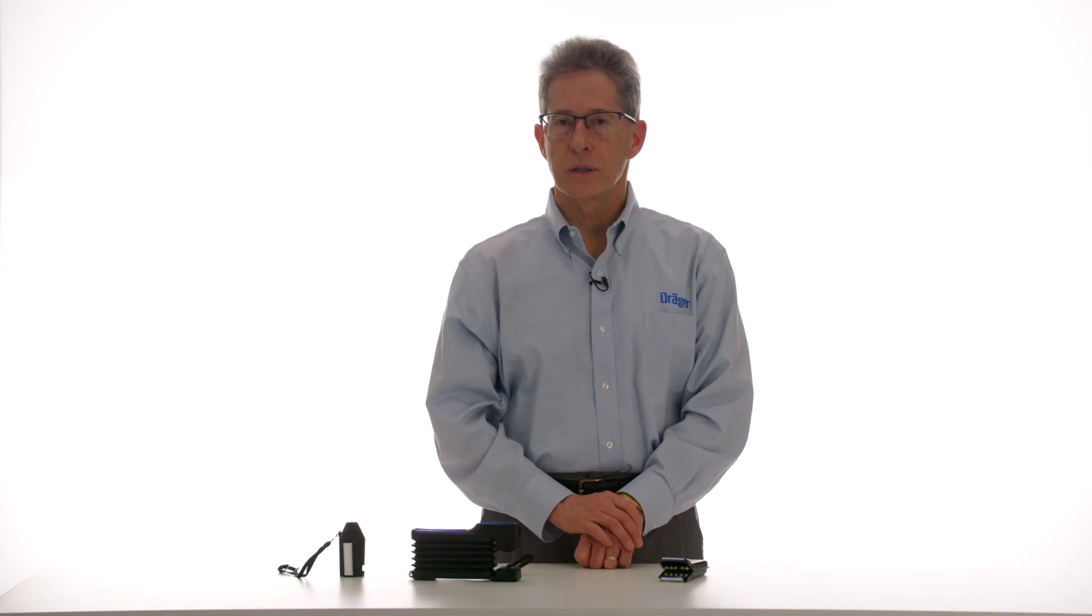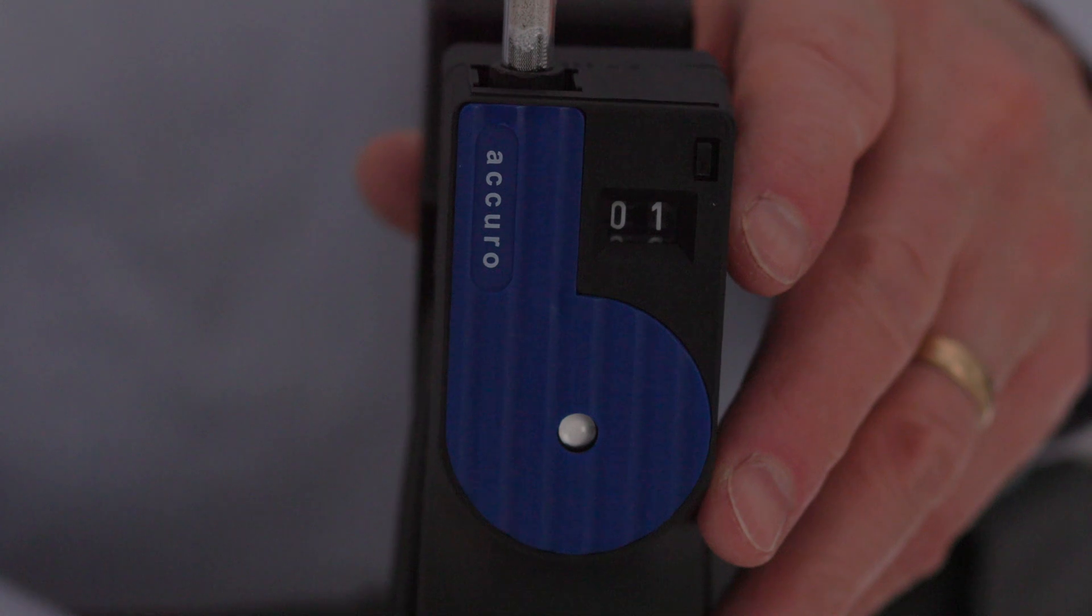Don't start a new stroke until the indicator is white, showing the completion of one pump stroke.